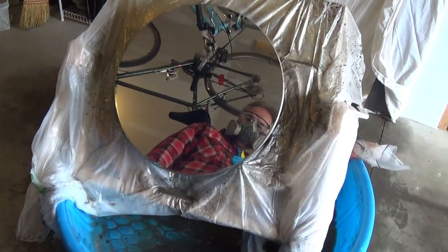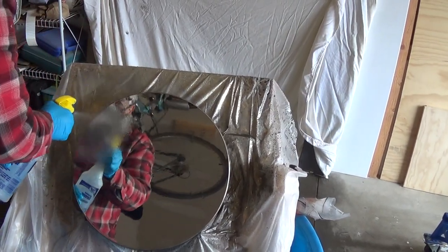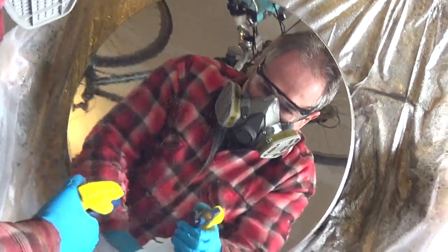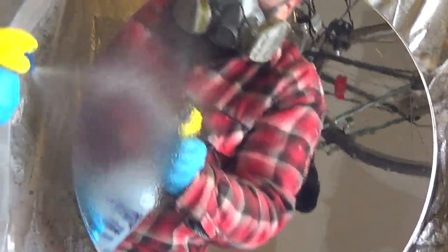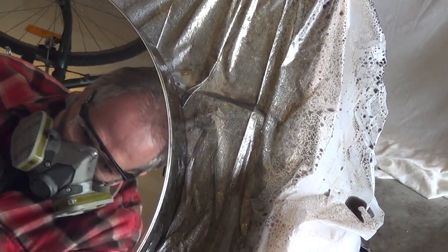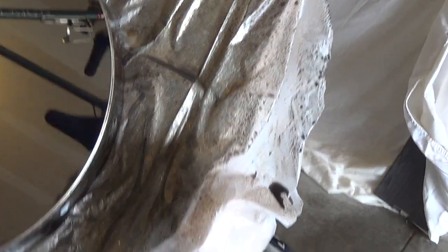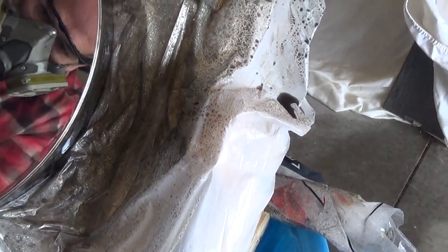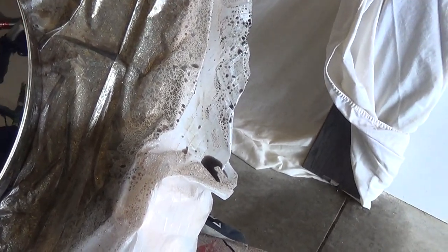Take a look at me through the mirror. Can you see it? Get everything off there. There's a little bit of white down there. It might not have been dripping fast enough. No — you know what that is? We're looking through the glass. That's what you're seeing — we're looking through the glass, and you're seeing the white through the glass.